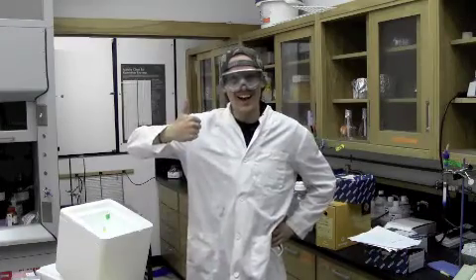First, a little lab safety. As with any procedure, make sure you tie your hair up, wear a lab coat, and goggles. Now you're ready to go!